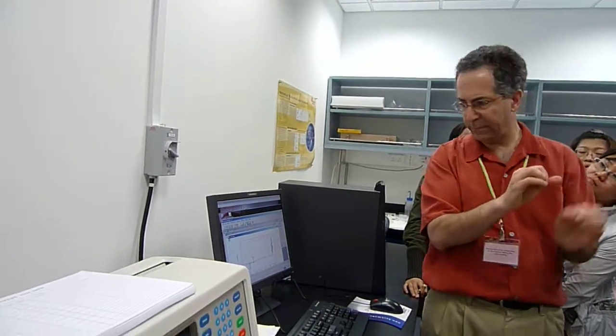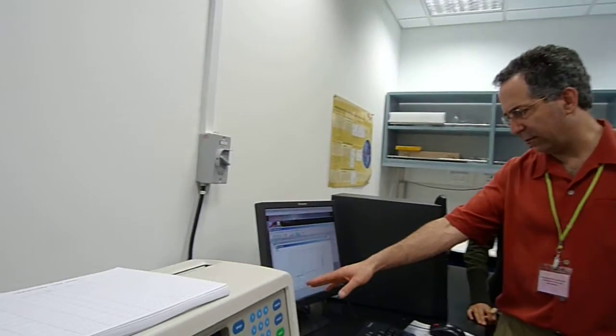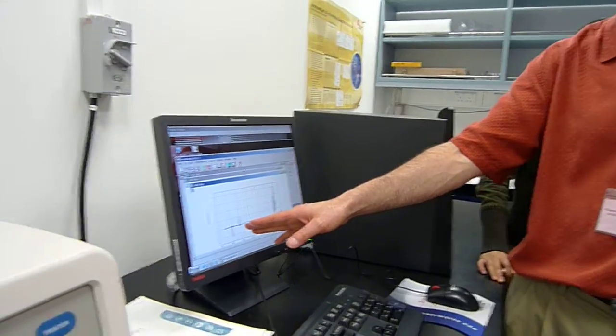And that's one of the reasons, when we assemble cells, that we use a compressed gas cylinder or a little can of compressed air to blow off all the dust from the windows and the centerpieces before you assemble them together, because that can cause a leak between the two. This one looks fine. Again, it's loaded a little bit less in both channels, but the difference between them is what we would have expected.